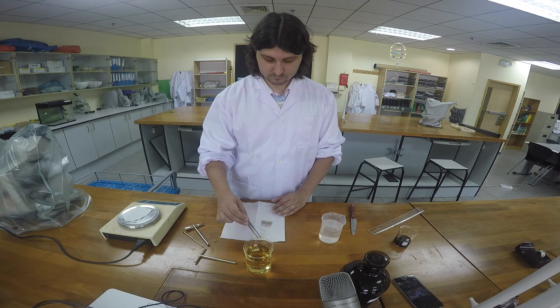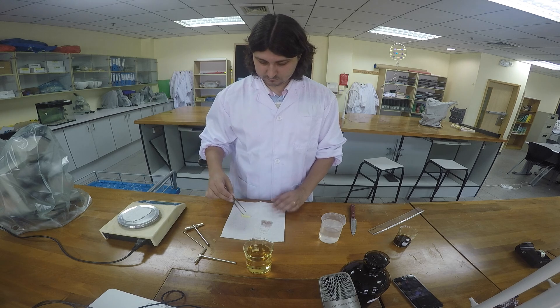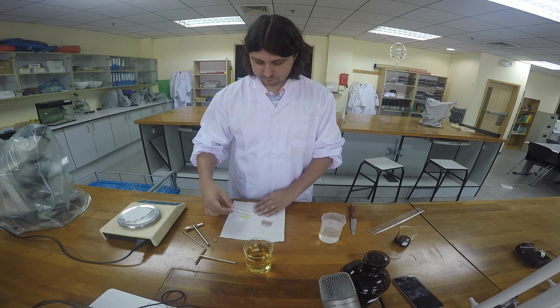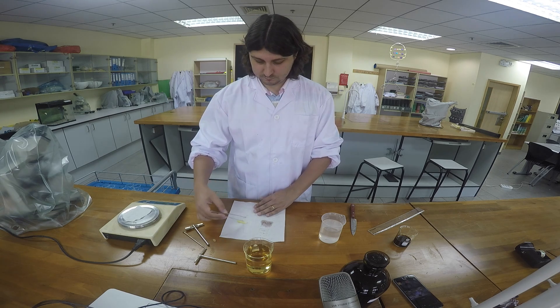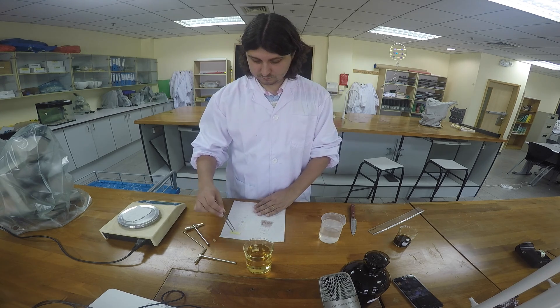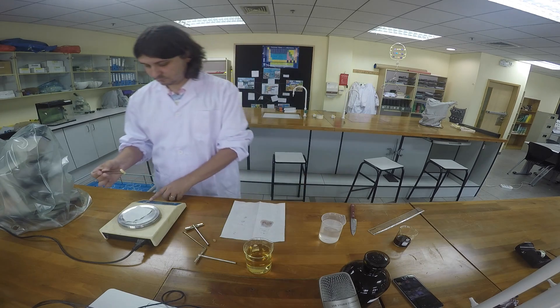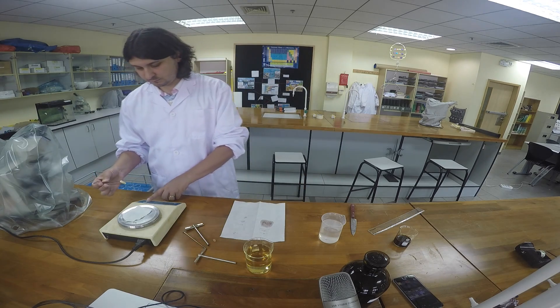When time is up, remove the cylinder using forceps and remove excess water using a paper towel. Then mass the cylinder again and record this information on your data table.